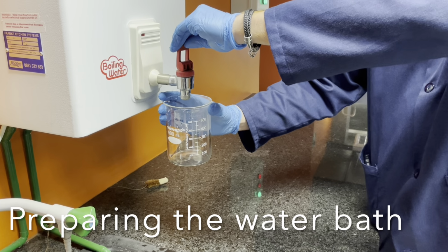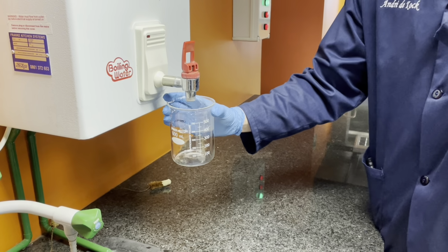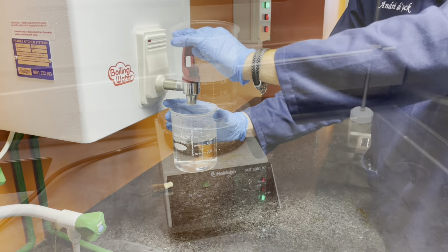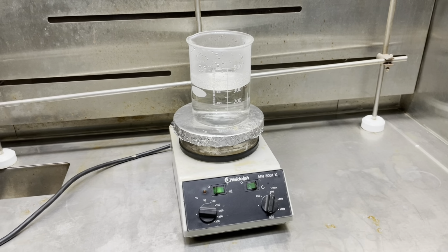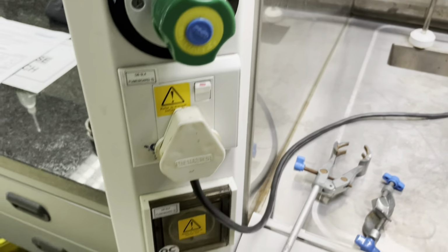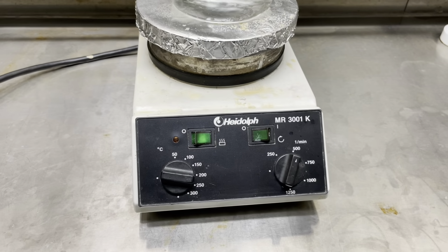In a large 600 ml beaker, collect approximately 500 ml of boiling water. Place the beaker with the boiling water on a hot plate, which is turned on at the hot plate itself as well as at the plug on the side wall socket. This will constitute your steam bath for the first step of your synthesis.